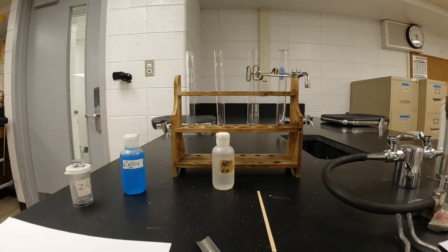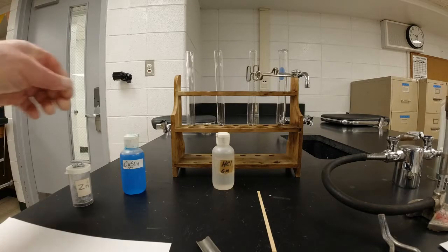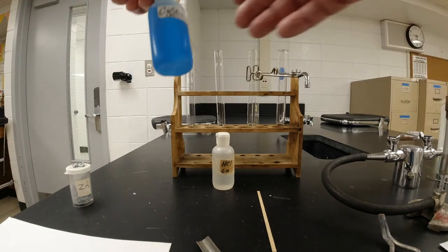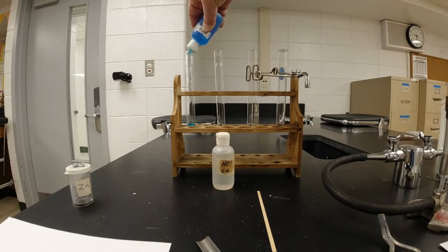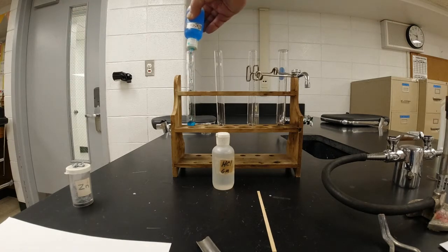If you go to the procedure on your lab, number 1 says that we're going to do a single replacement reaction. And we need to put 5 milliliters, about an inch, of copper 2 sulfate. That's copper 2 sulfate, and it's a lovely blue thing. Copper 2 sulfate is used to disinfect cuts. I saw this used in the veterinary shows. It's also used to kill algae in ponds. And this one hasn't been used in a while. It's leaking all over the place, but it'll be all right.